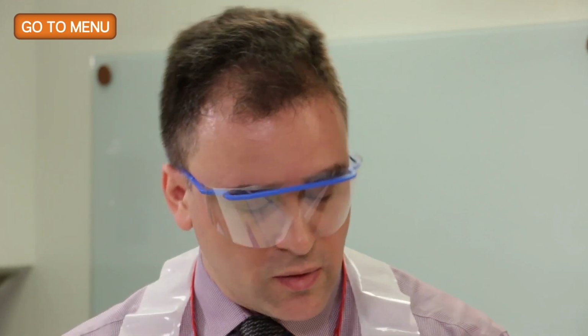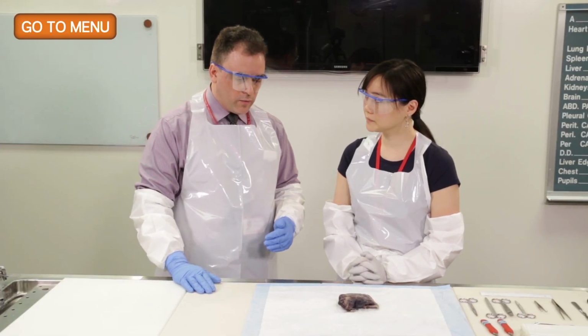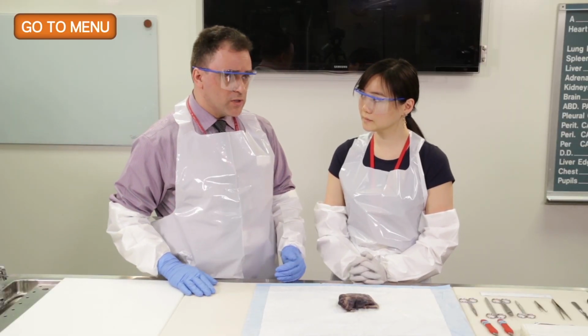What are the sorts of things that we check today on this specimen? Well, we like to know how many nodules are there, what's the size, where's the location specifically, and of course, which lobe and which segment, if anything, depending what sort of specimen it is. Now, we ascertained that this was a lobectomy specimen.